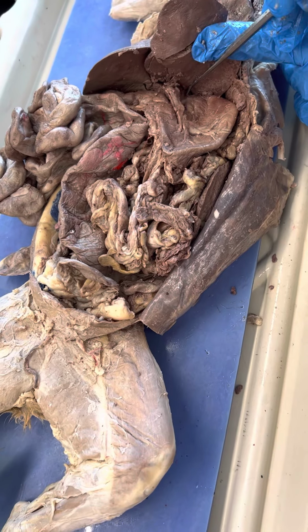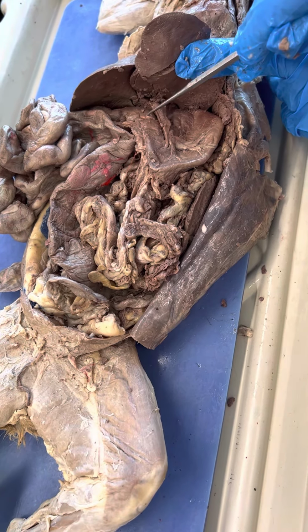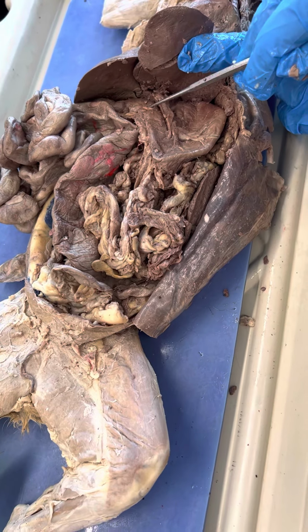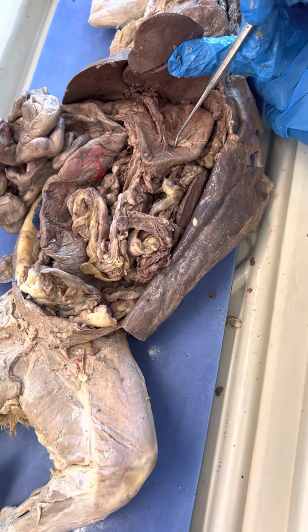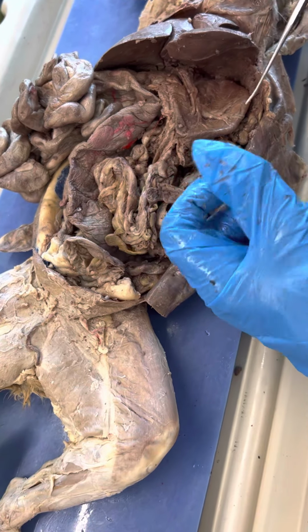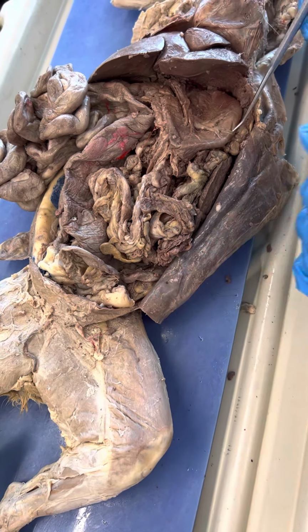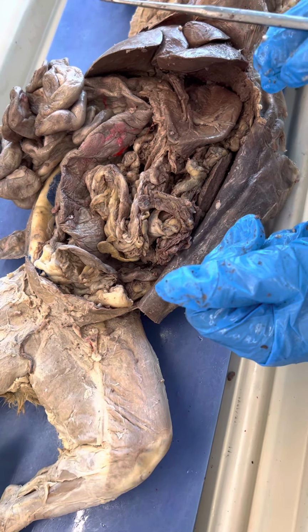Cardiac valve is up here. Pyloric valve would be inside here. If it's asking you for a valve, you have to watch the question. Where the pylorus connects to the duodenum, inside here is the pyloric valve. The rugae are inside. If I were going to ask this on a lab test, I would cut the stomach open and show them to you. They're folds. You could also get them on the human model. Or you could say, what do we call the folds inside? I didn't look that close at the questions to see how they did that.